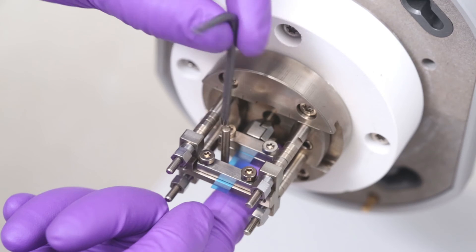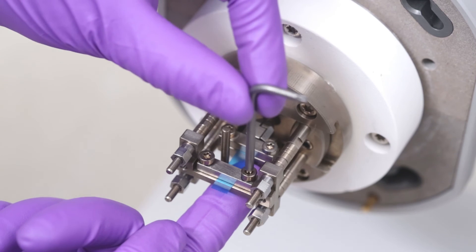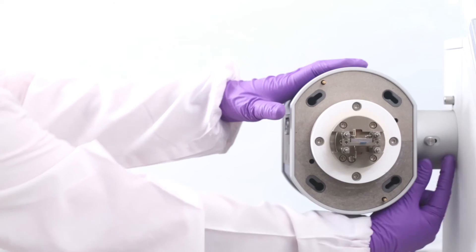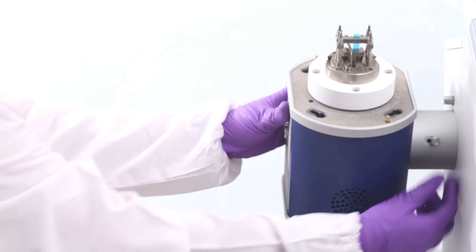Now, tighten the two screws on the fixed part of the clamp using the T10 Torx key. Now, you can rotate the measuring head to the vertical position.